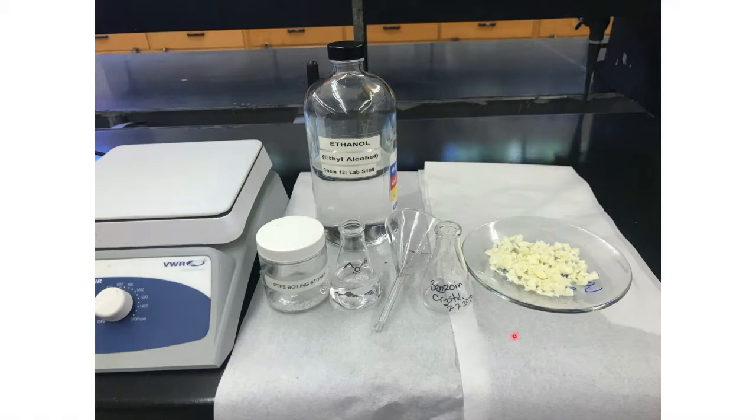Okay, time to crystallize. I'm going to take the crude benzoin here and dissolve it in hot ethanol. So I'll have my ethanol in here, and that ethanol is going to be heated on the hot plate with the boiling stones. These are the Teflon boiling stones, polytetrafluoroethylene. I use a funnel so I don't spill. So this will be my ethanol. I heat it up to boiling gently, and after I put all of my crude benzoin in here, I'll add just enough hot ethanol to get it to dissolve, let it cool and crystallize, and do another vacuum filtration. So let's watch a video on that.